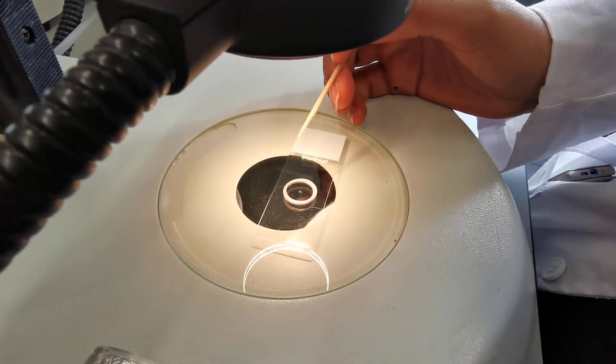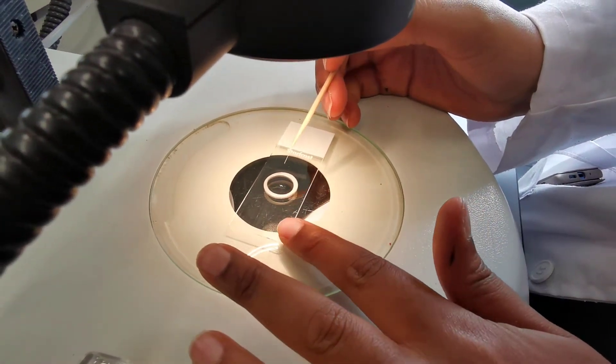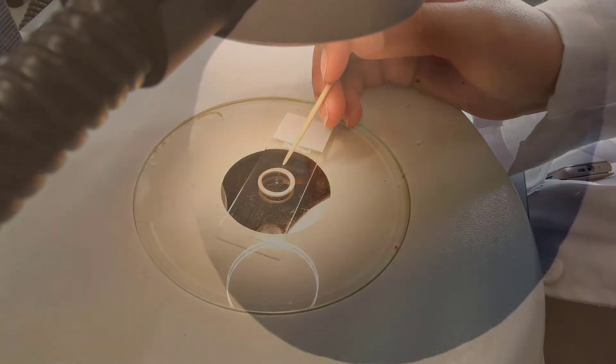We will then mount the specimen on the glass slide. We will push the specimen on the surface of the glass and adjust its position however we want.